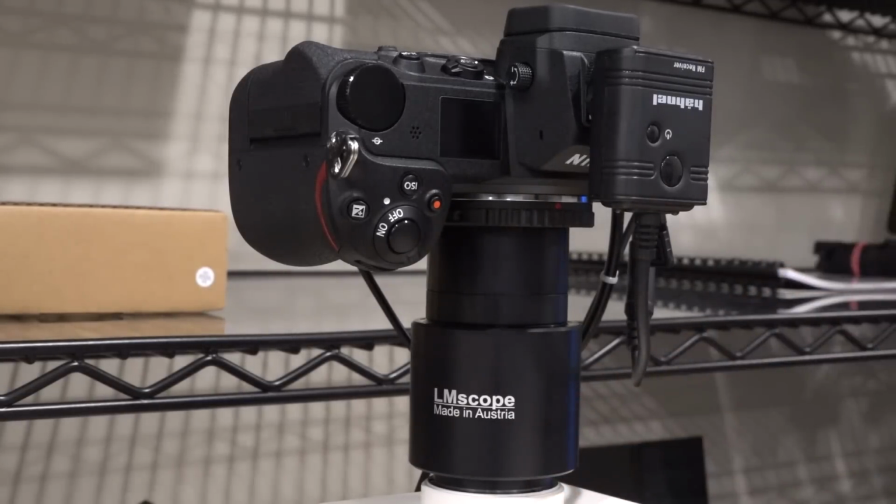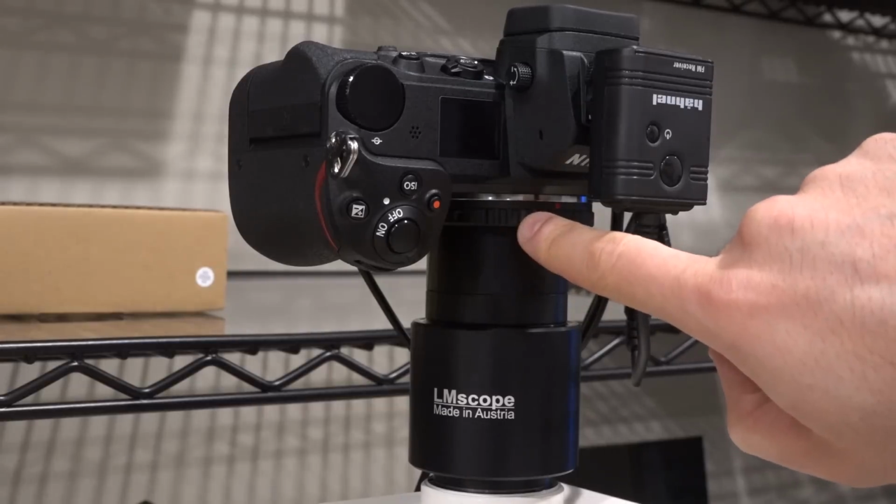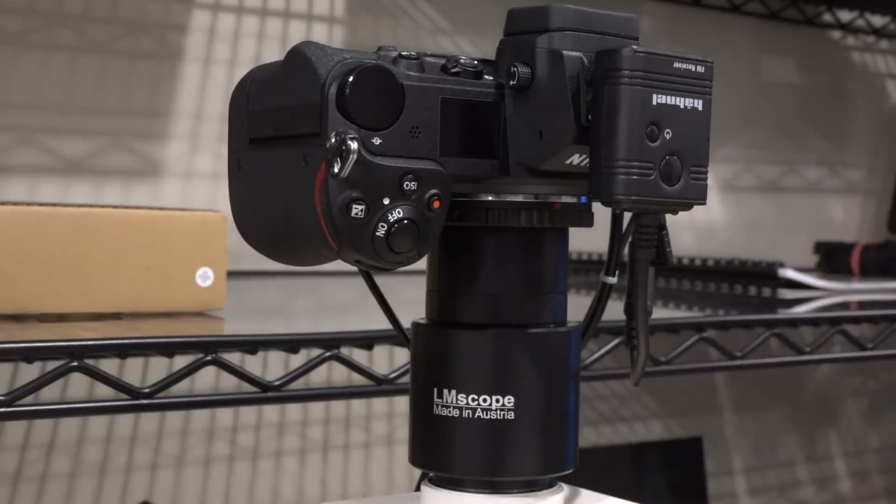This is from LMScope. It's an Austrian company. And it really does give you the lowest vignetting and barrel distortion or any chromatic aberration in the image. And it does a very good job at translating that. And they helped me find the appropriate components. And you can see that there's a direct Z mount attachment to the camera, so it keeps this distance as short as possible, essentially making sure that everything is as good quality as it can be. So this by far gave me the cleanest image. We just have to look inside the MCU28 before we make some images.